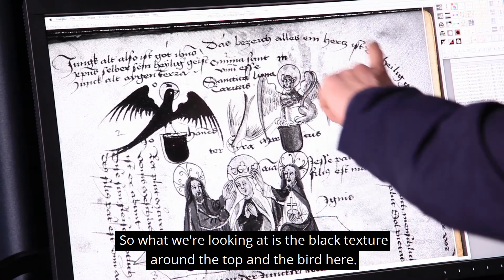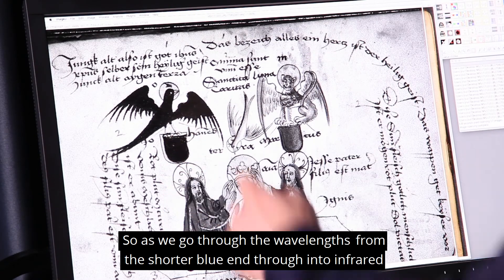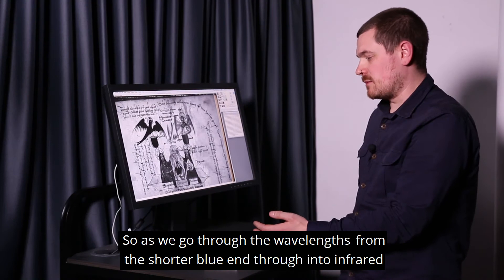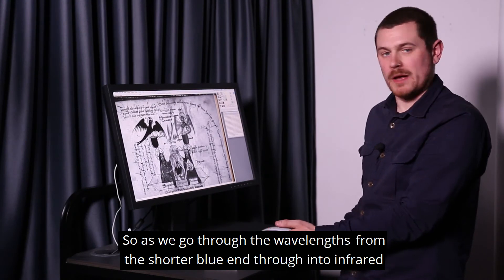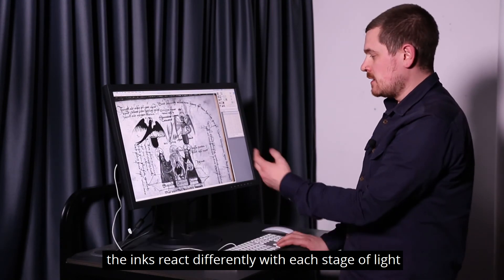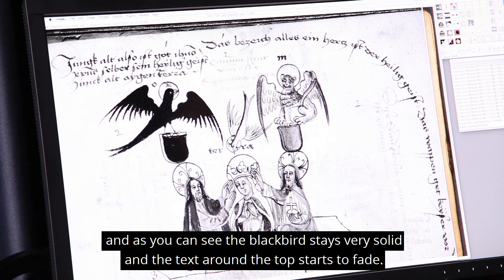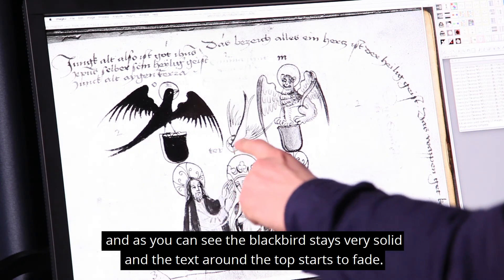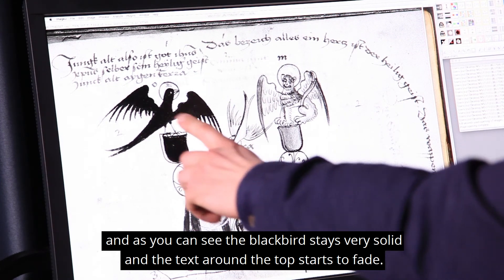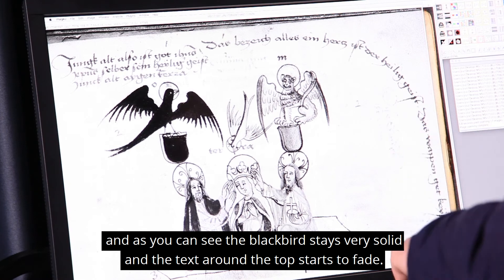We're looking at the black text around the top and the bird here. As we go through the wavelengths from the shorter blue end through into infrared, the inks react differently at each stage — as you can see, the black bird stays very solid and the text around the top starts to fade.